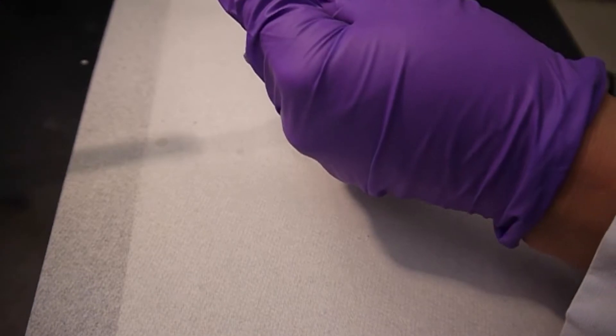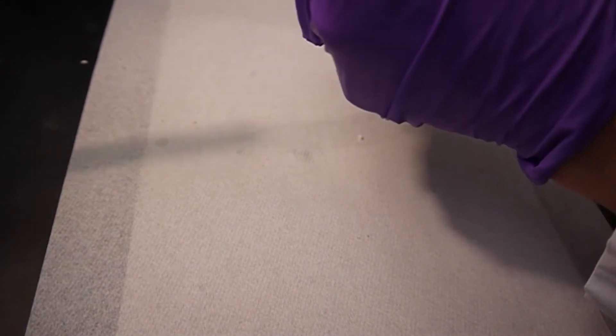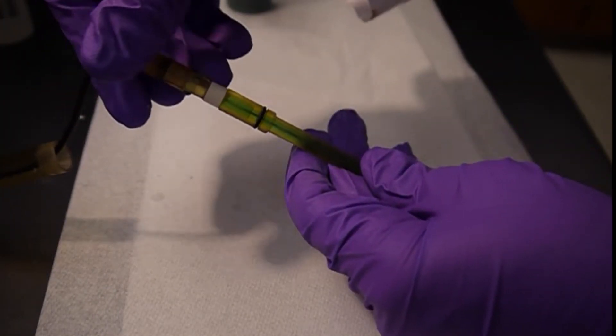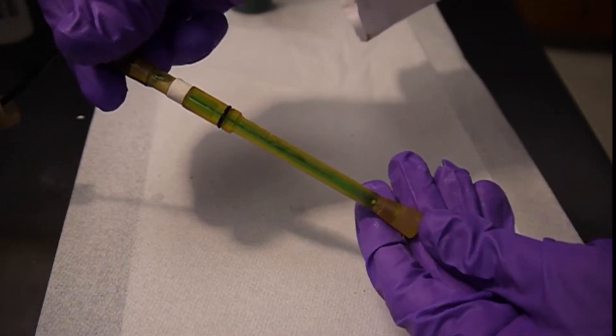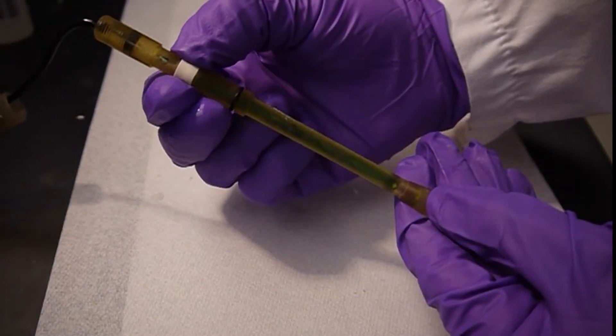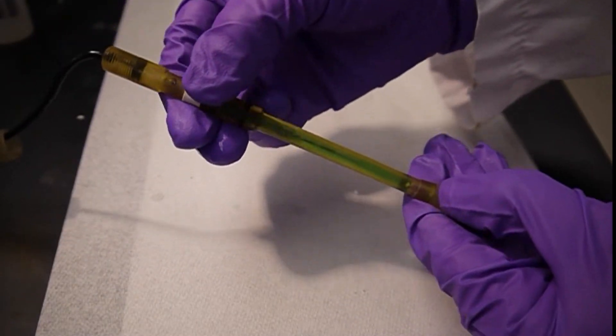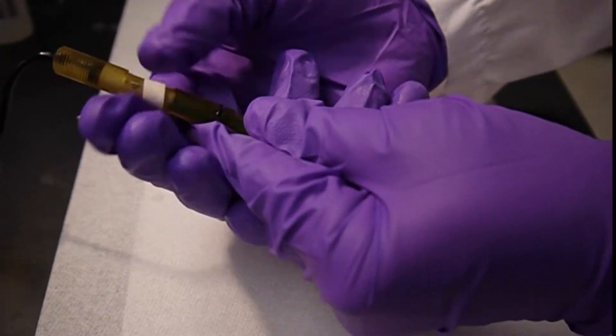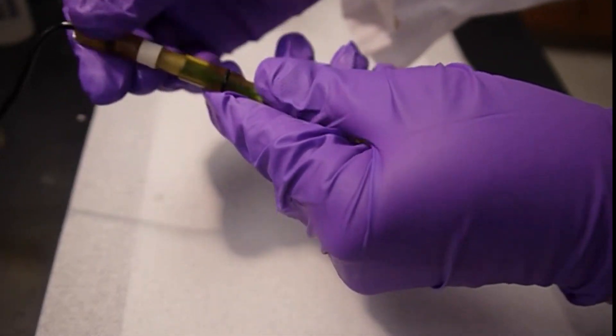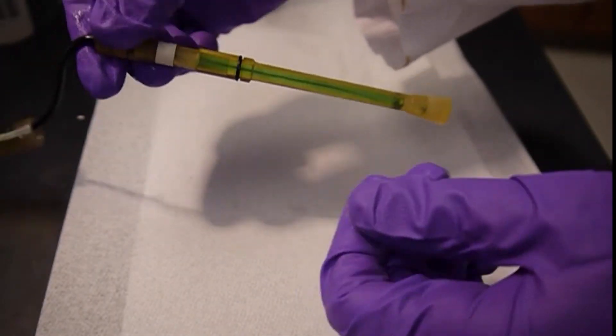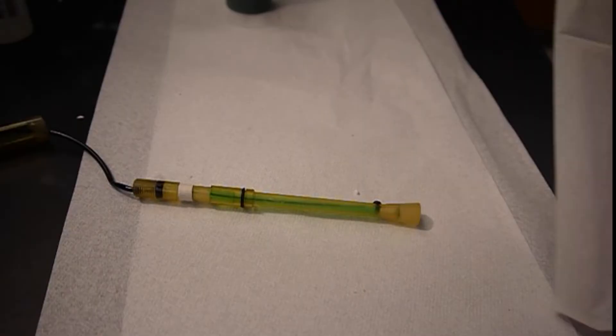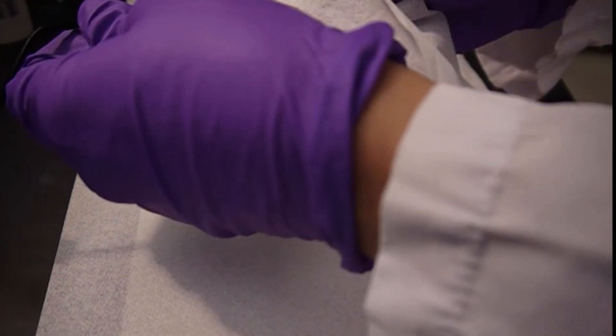Let's kind of shake it down. It gets a little messy. There we go. Alright, so I filled the solution. I'm going to slide this band up to cover the hole. Alright, so that is filled. I'm just going to wipe that with a Kimwipe.